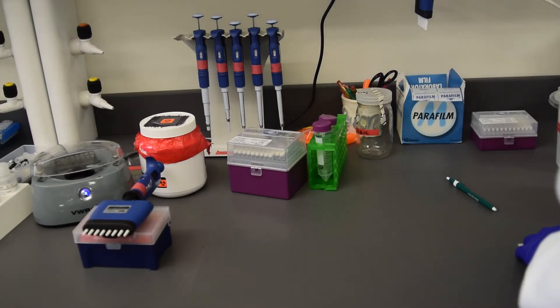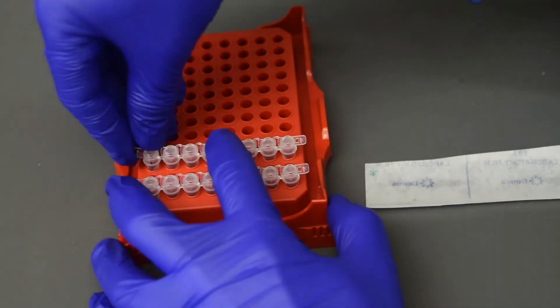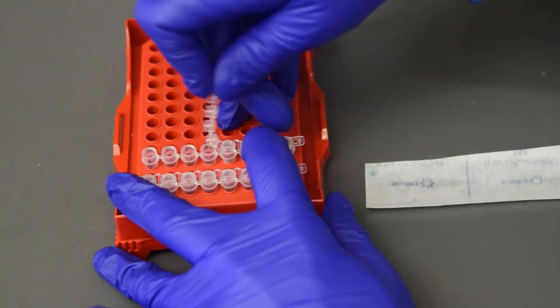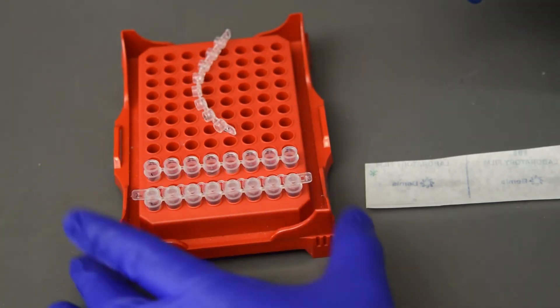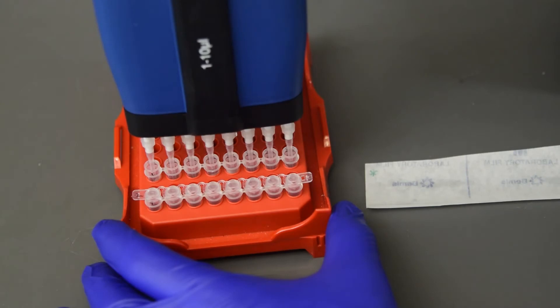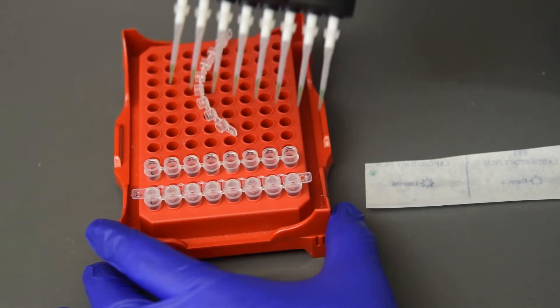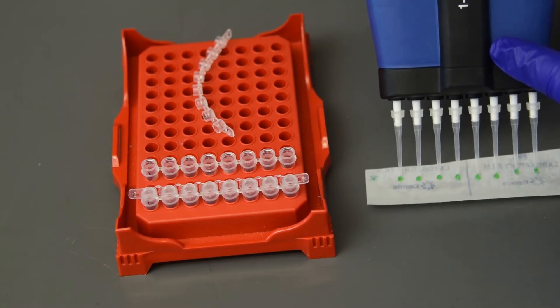Cut a strip of parafilm then mark one corner with a marker or pen. Open the PCR strips carefully and pipette 2.5 to 3.5 microliters onto the parafilm. Larger amounts are better for more samples because evaporation will occur over time.